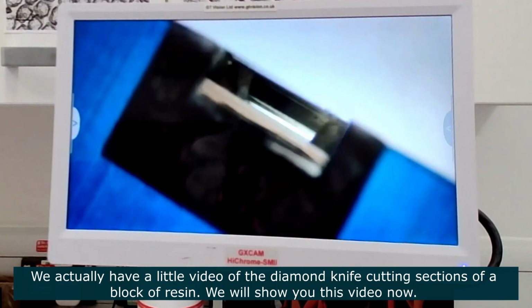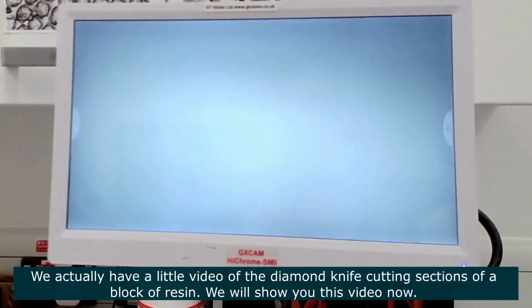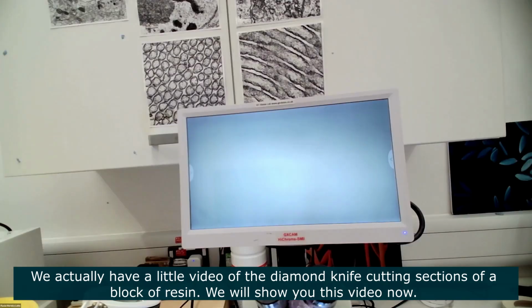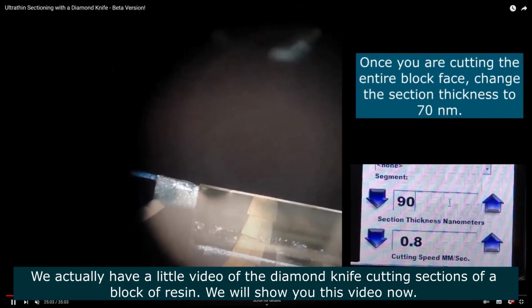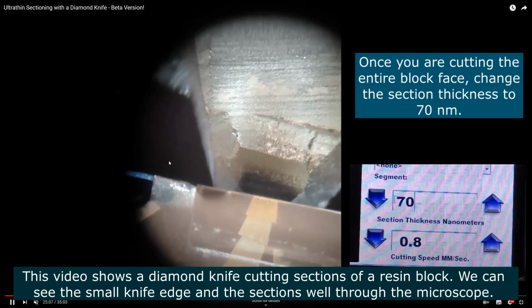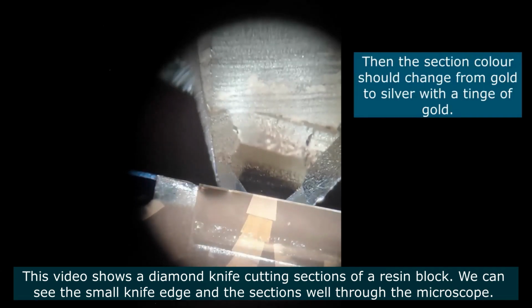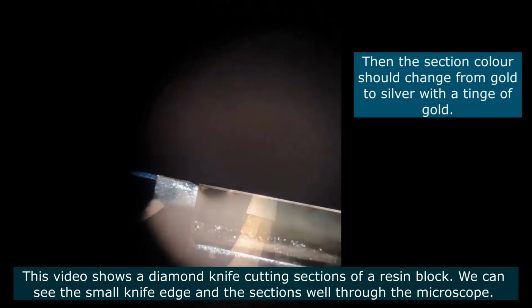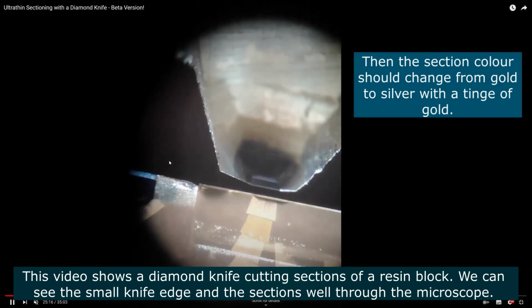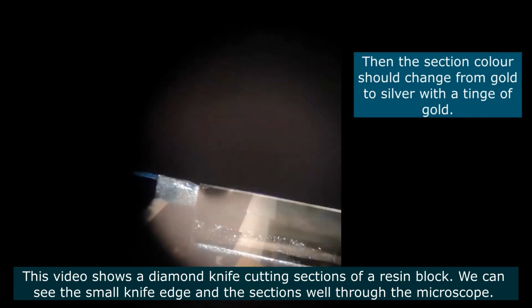We actually have a little video, don't we, Ed? Yes, of the diamond knife cutting sections of a block of resin. So we will cut out to the video now. So this video is showing the diamond knife cutting sections of a block of resin. And we can see this diamond knife through a microscope because it's very small and the sections are also very small.